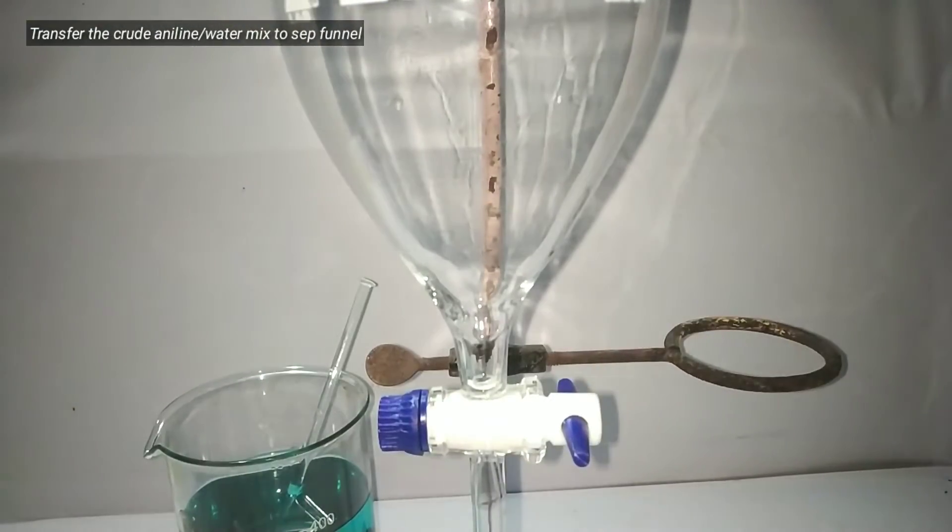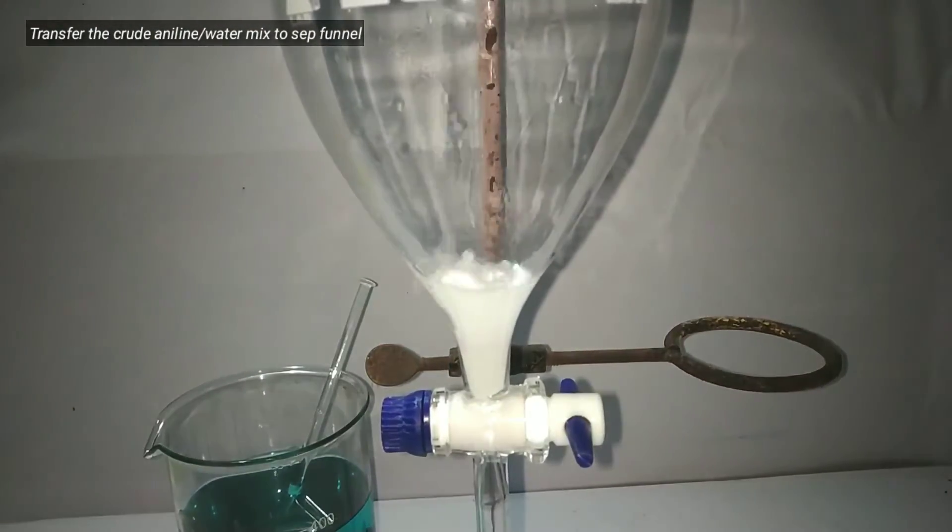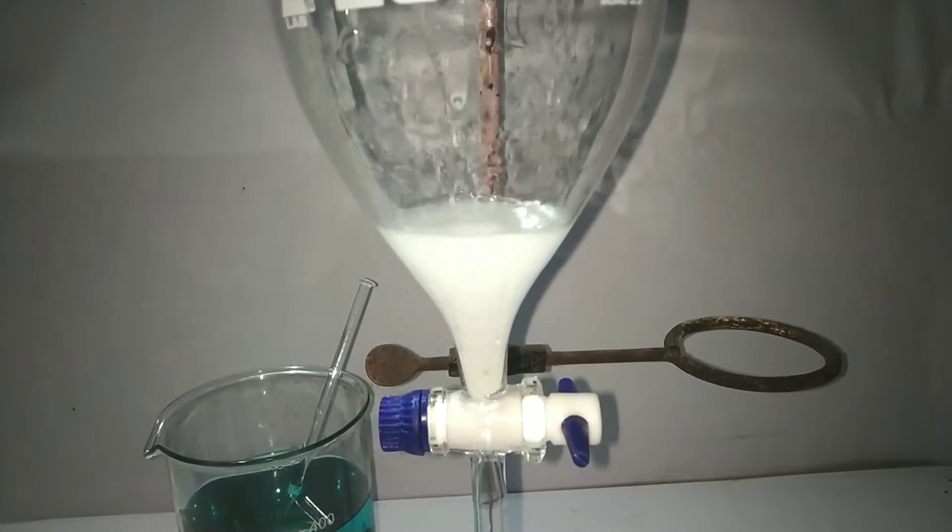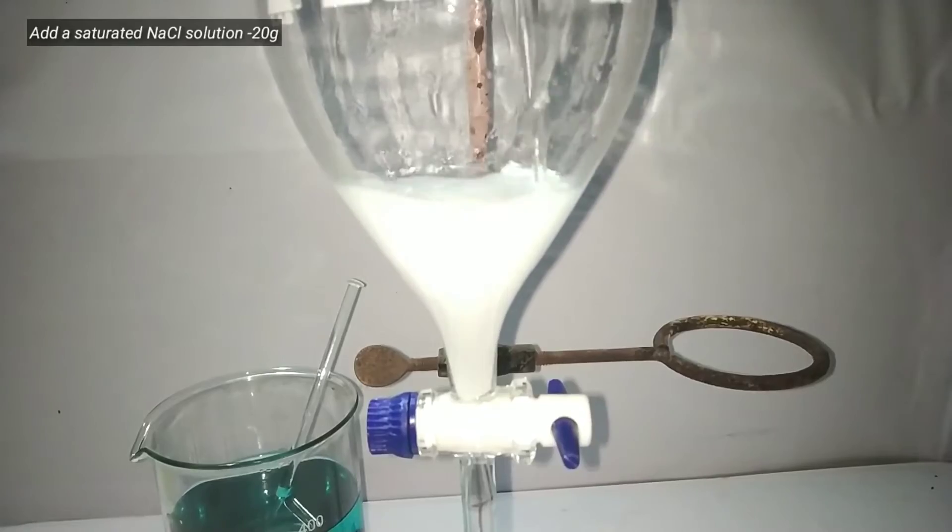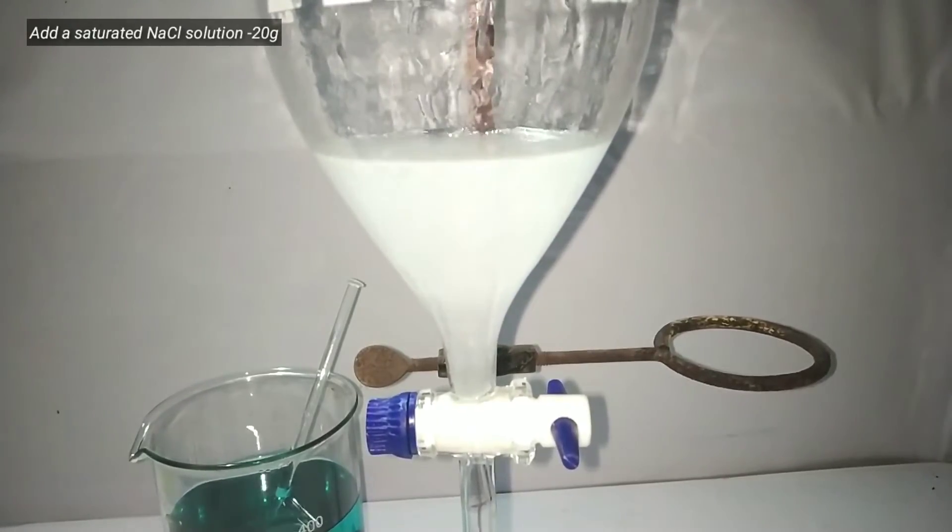The distillate was poured into a separatory funnel and the distillate was washed with saturated sodium chloride solution containing 20 grams of the salt.